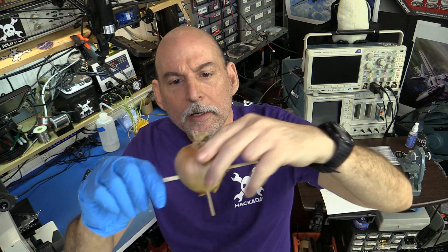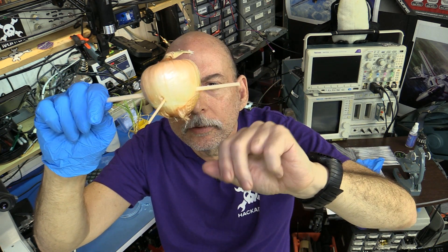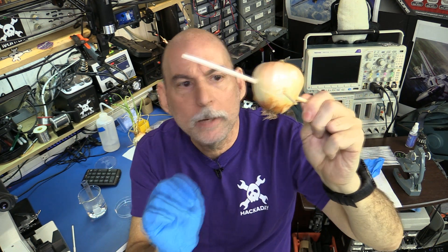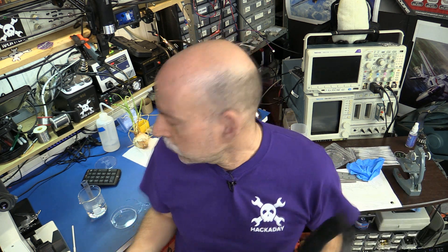I've taken an onion — these have been sitting all over my house. It takes me a couple weeks to make one of these videos so I had to go through a couple onions where they sit and rot in the kitchen. But what we're after are these real tiny new onion roots. I suspended this in water; there were no fresh roots when I started, but now we have them. I'm cutting them and placing them in a small petri dish, and then I'm going to wash them with hydrochloric acid. If you think that sounds like how you digest something in your stomach, you would be correct — I am going to digest away part of the cell walls to see the chromosomes. I've got some one-molar hydrochloric acid warming up in a small water bath, and I'm going to put these tips in there for about five to ten minutes to pre-digest them.